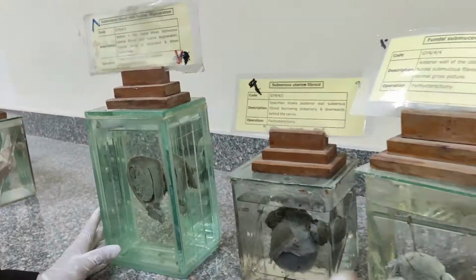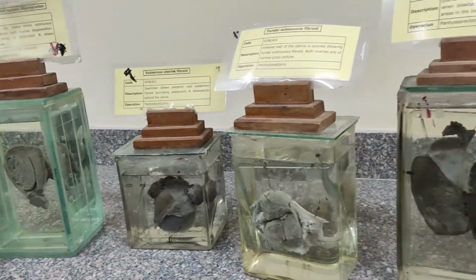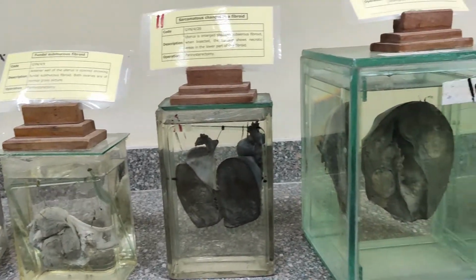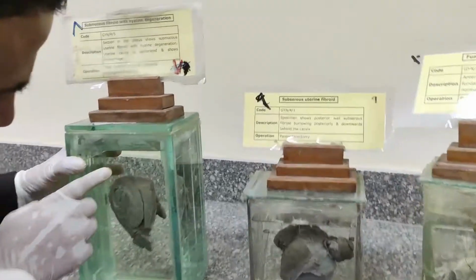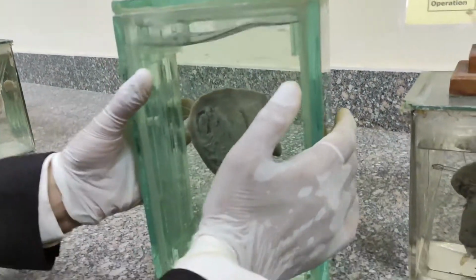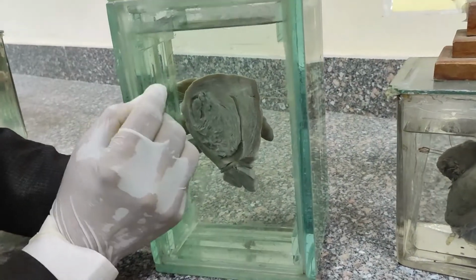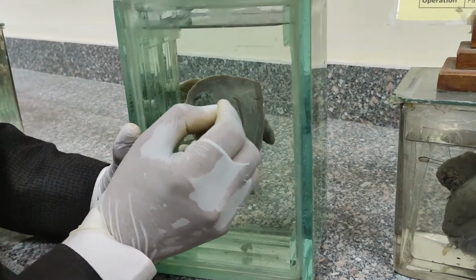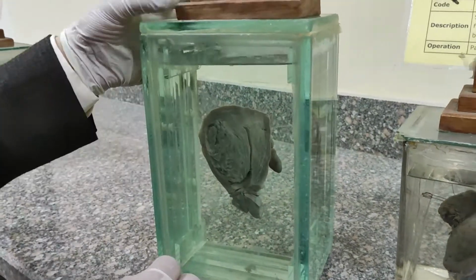This group of jars belongs to fibroid. A fibroid is a benign tumor arising from the uterine muscle and surrounding fibrous tissue. Look at this jar. Here we removed the uterus, the tubes and the ovary, but the uterus is cut in the coronal section to show a large submucous fibroid burrowing to obliterate the uterine cavity.